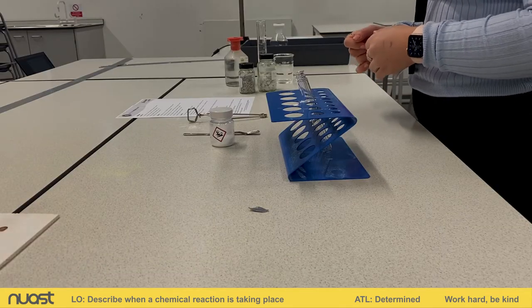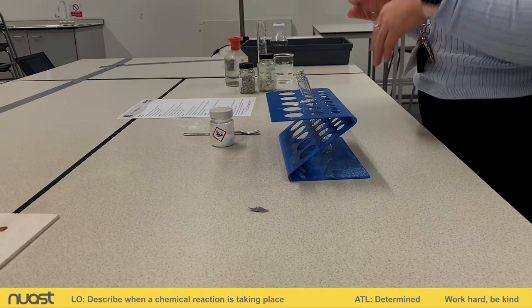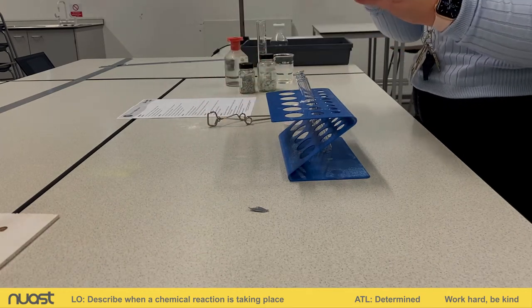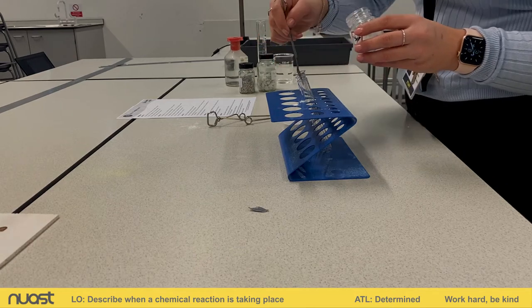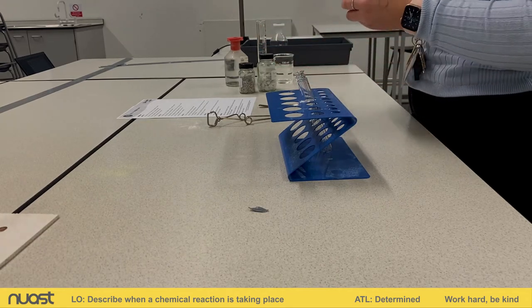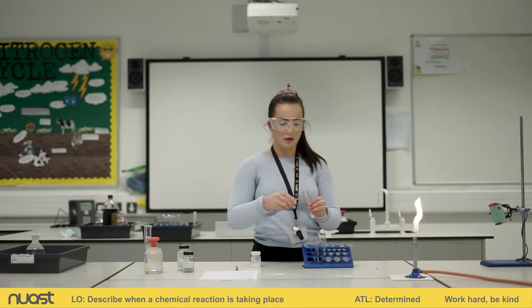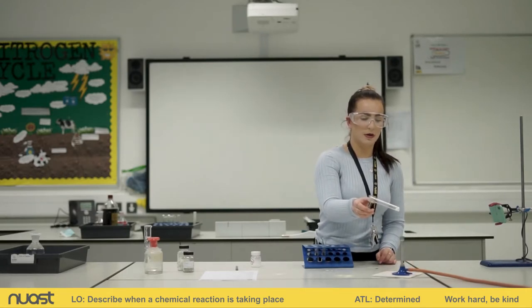We're going to go on to station C now. Station C says to place two spatulas of zinc oxide into a test tube. We're then going to use our tongs to hold that test tube while we put it into the Bunsen burner to heat it up, and we're going to see what happens. Then we're going to let it cool down and see what happens then as well. I'm carefully putting about two spatulas of zinc oxide into my test tube.